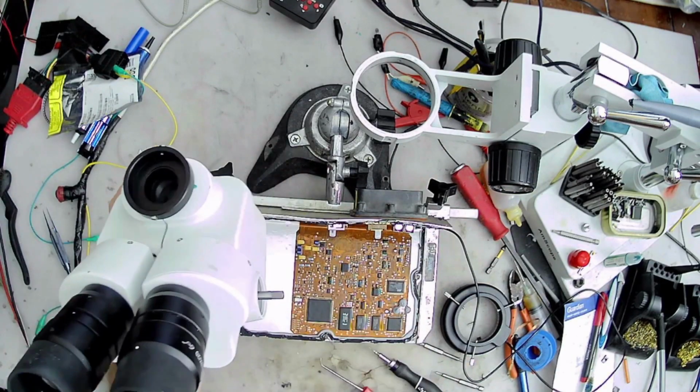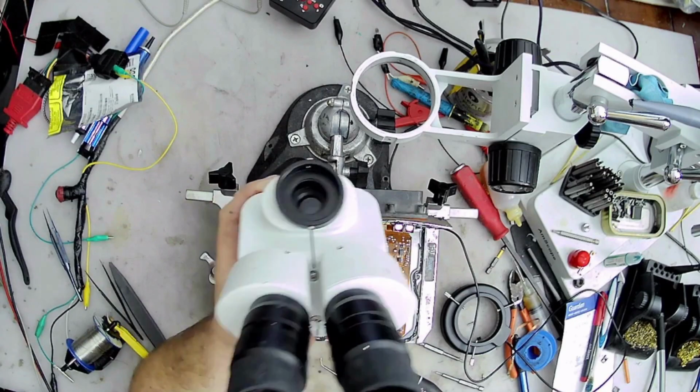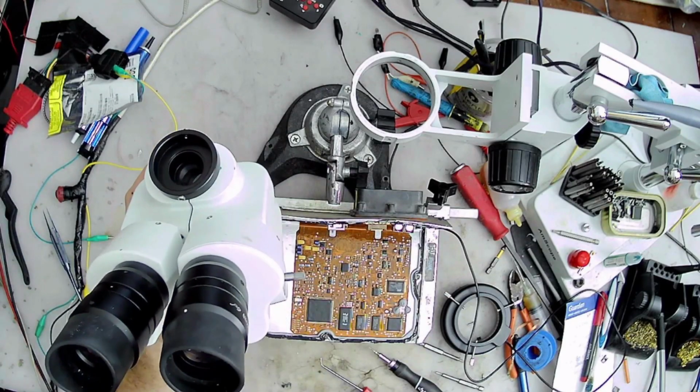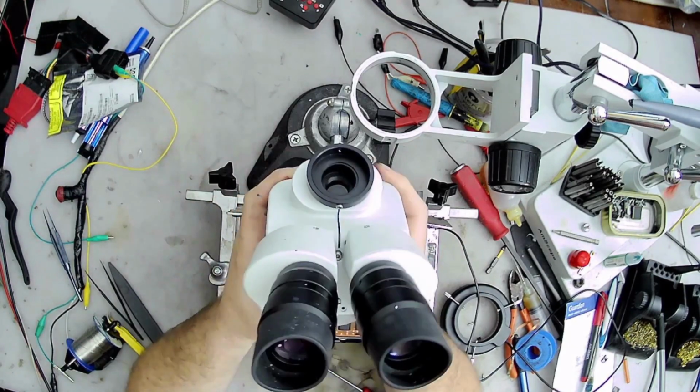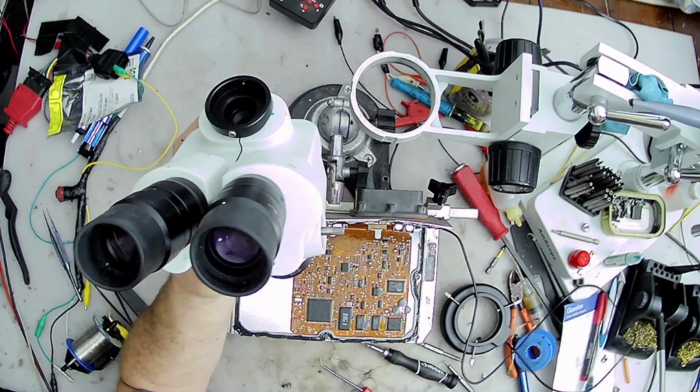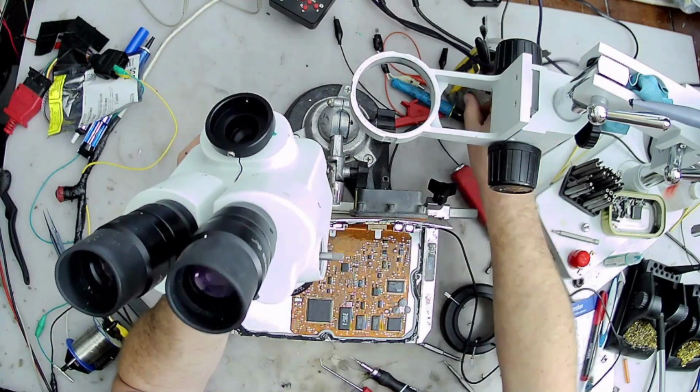It's kind of a pain because of the way the thing does snap together. But it's not too bad. It's actually very simple thing to do.